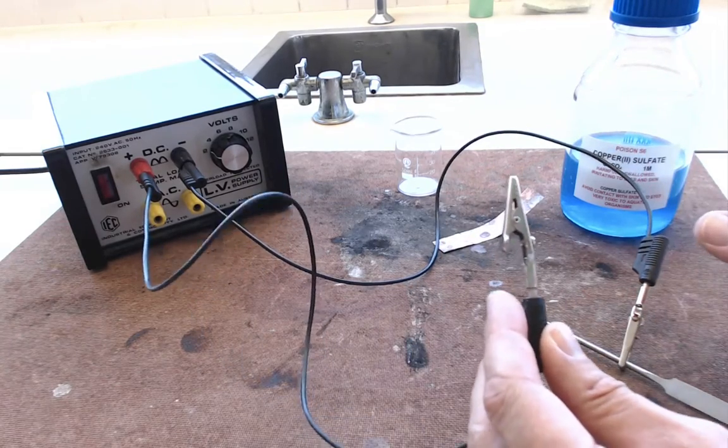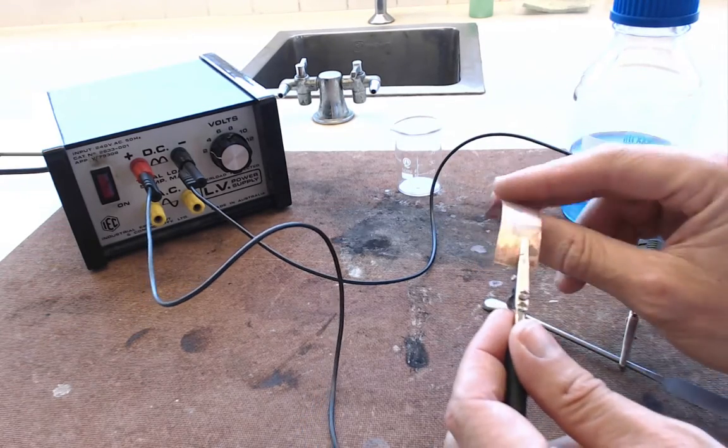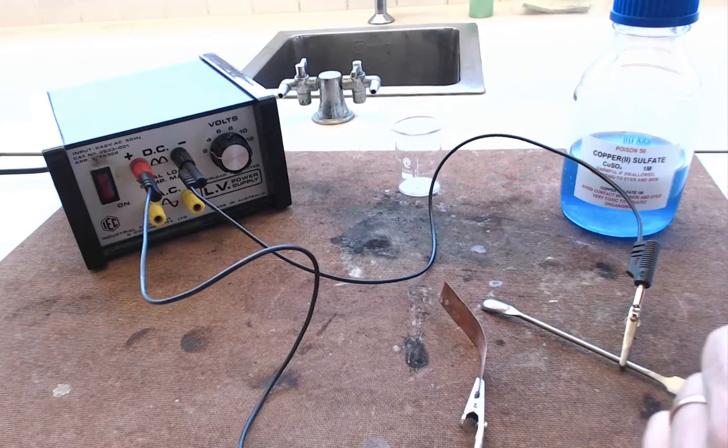The crocodile clip that's on the positive terminal, that needs to be attached to your copper electrode. Okay so that's the way to connect those.